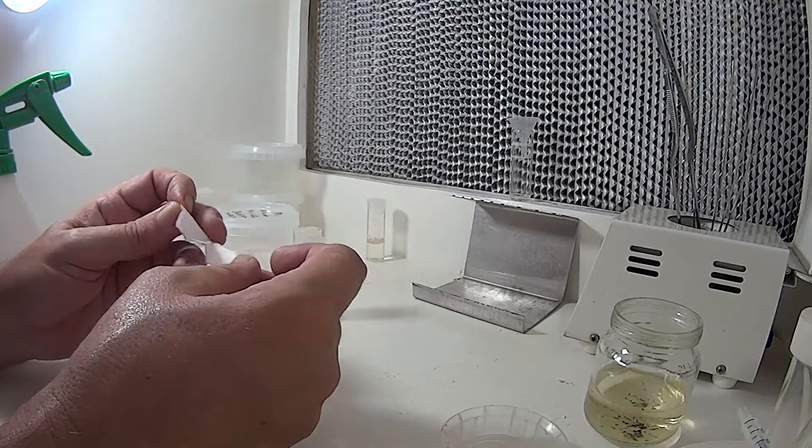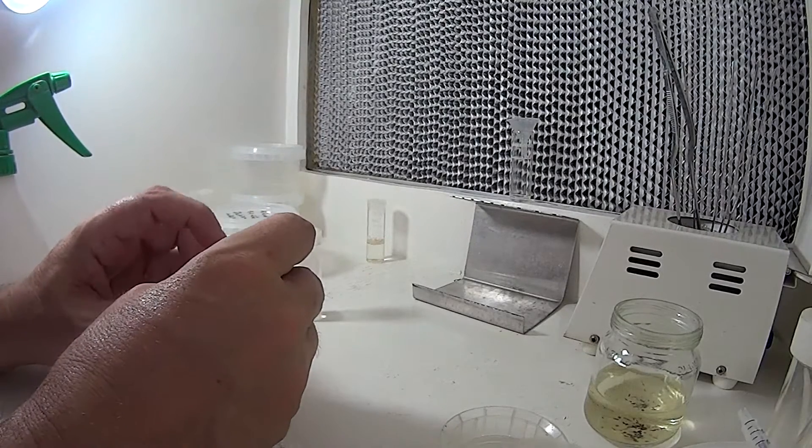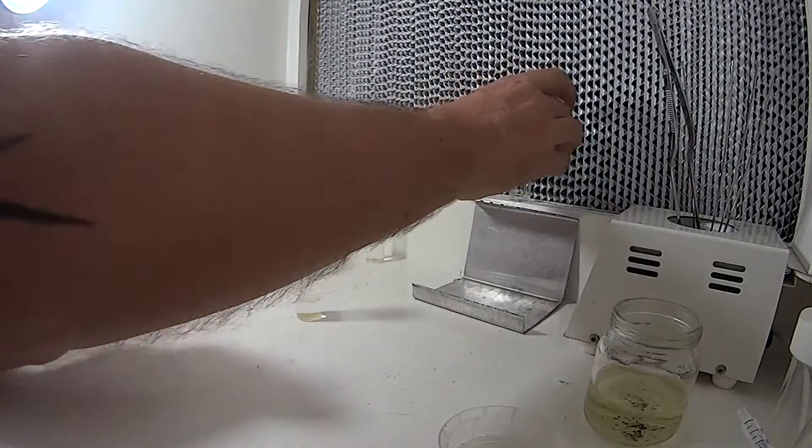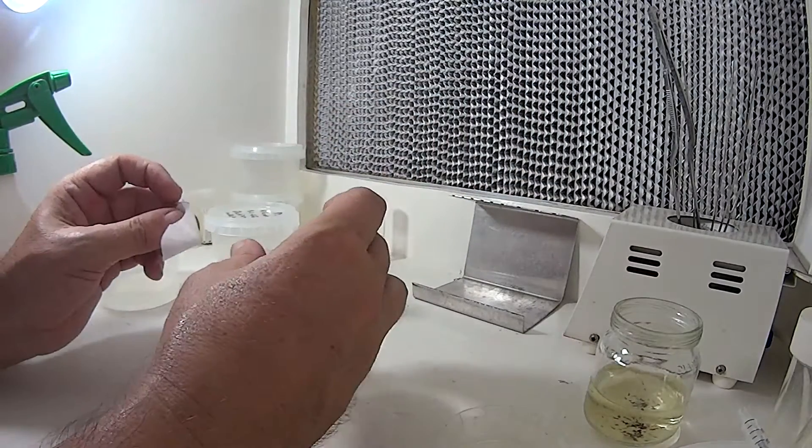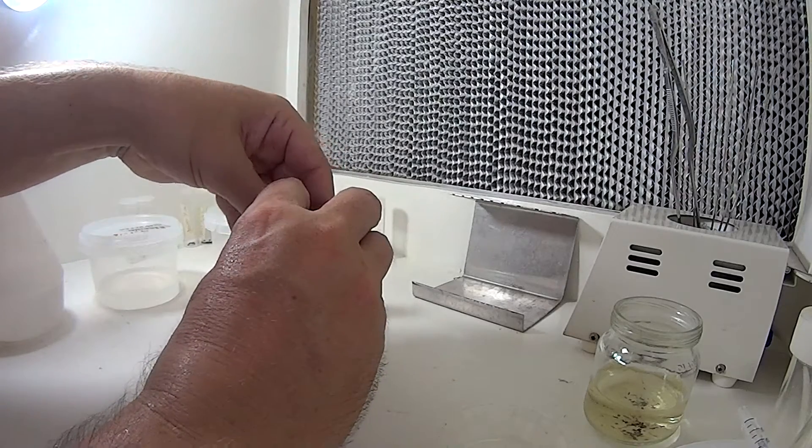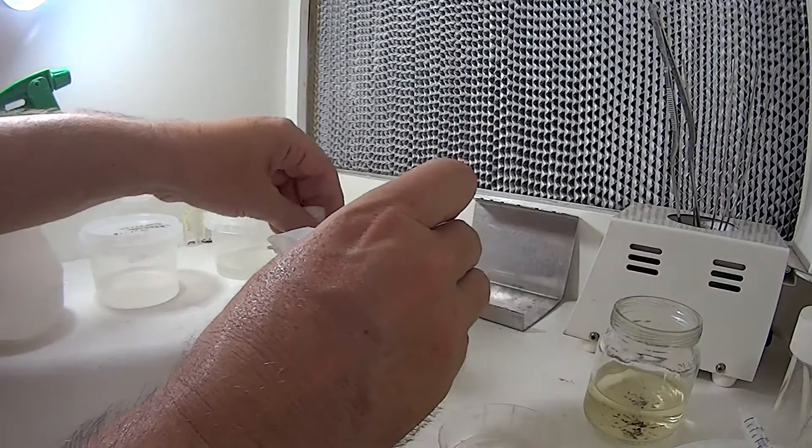And then we undo it, but anything like this will work, and then we make a little cone out of it. So I've got sitting here is a tiny little plastic funnel, and I sit the filter paper in there, hopefully it stays in there, and I'll sterilize it.